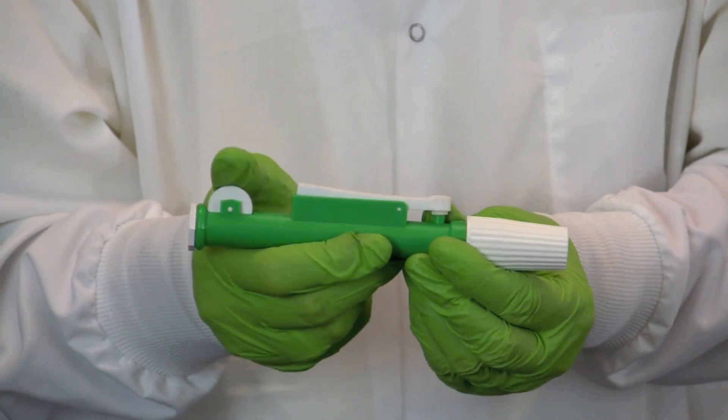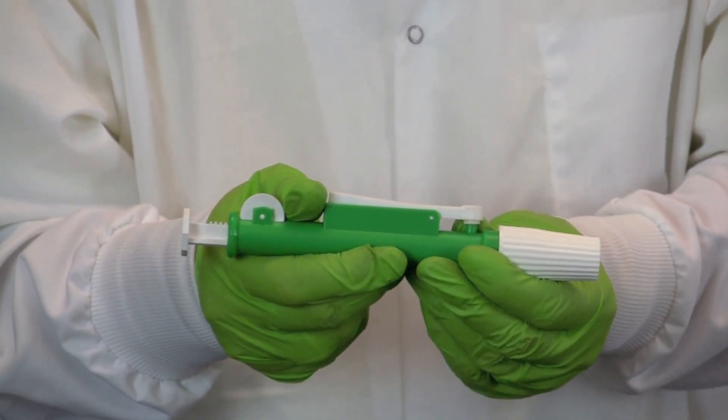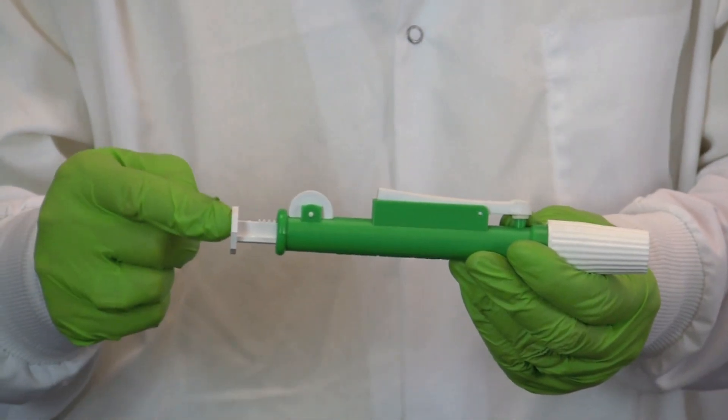A dial which is used to adjust the amount of solution transferred, and the plunger which is used to blow out any remaining solution.